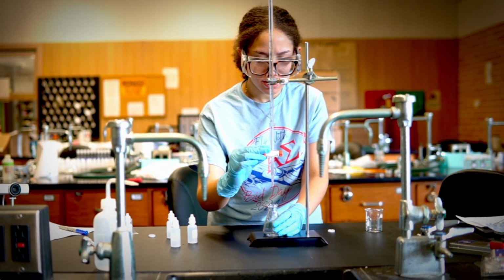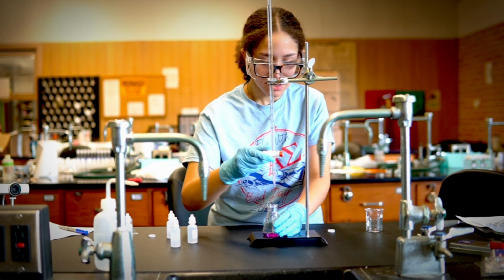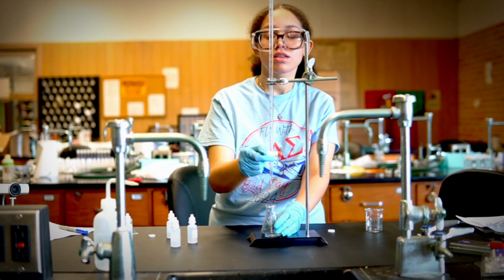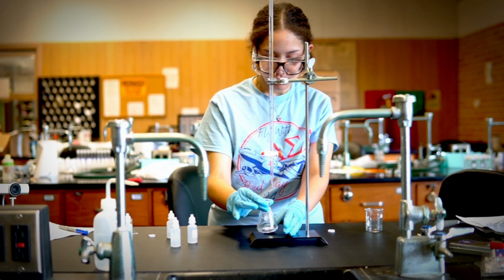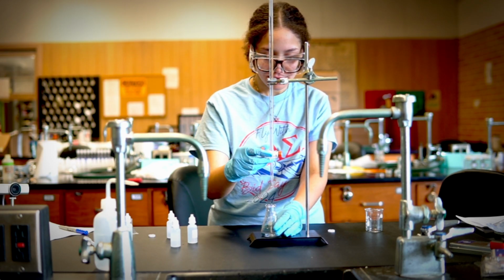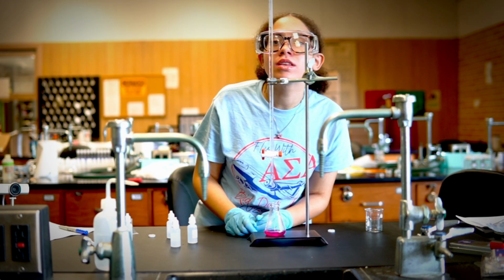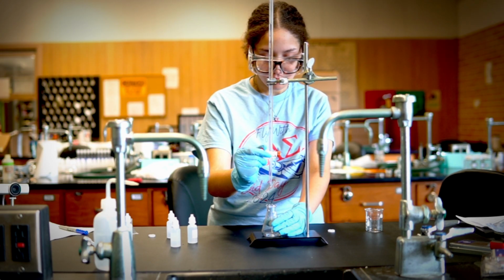And as you titrate, we are looking for a color change that doesn't go away. So as we start titrating, you'll see that the color changes, but when we mix, the color goes away. So we're gonna have to keep doing that. But since we're going to do two of them, the first one you're gonna do it quickly. You're gonna do it quickly, and you're gonna keep going until you get to a color change that doesn't go away. So you're going to add like 1 milliliter. Stop, mix, and as you can see, whenever we mix here, it goes away, right? Until we get to one that stays, right? Until we get to a color change that stays.